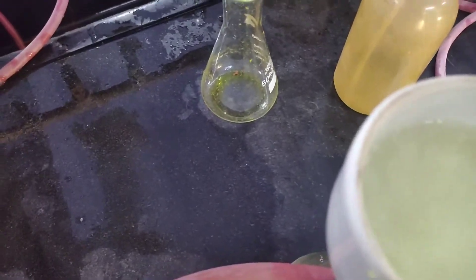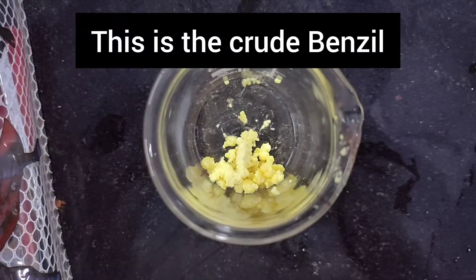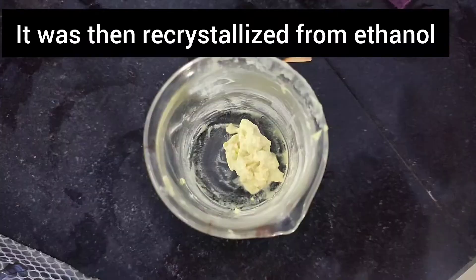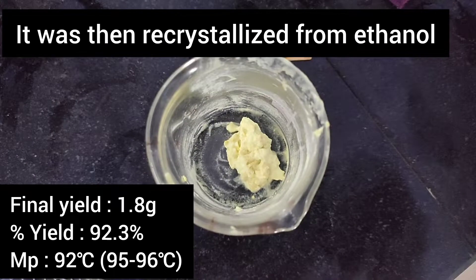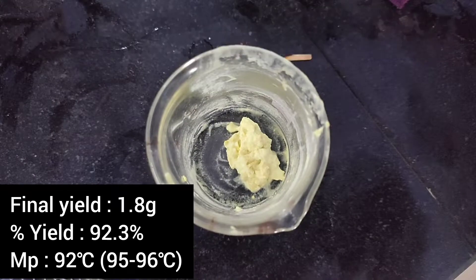You can see that this is the crude benzil — it is a yellow colored compound. It was then recrystallized from ethanol, and the final yield came around to be 1.8 grams.